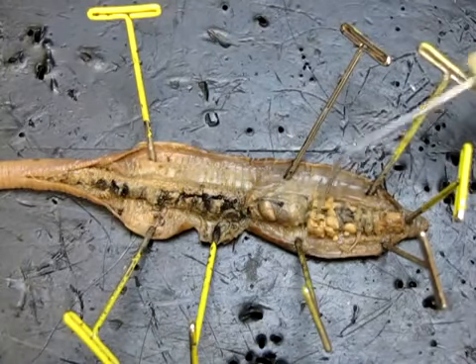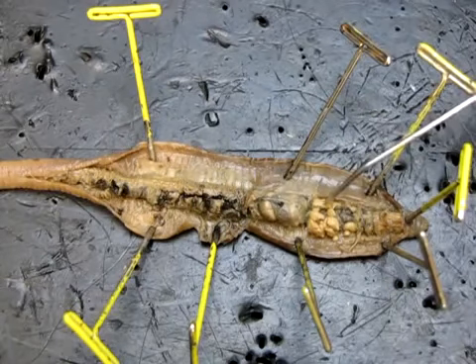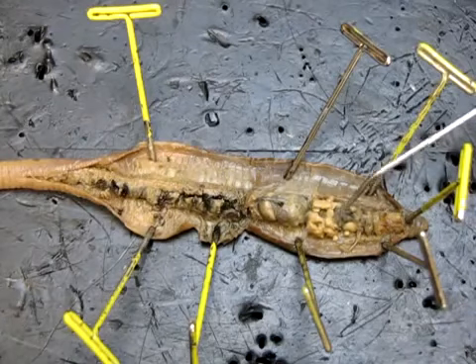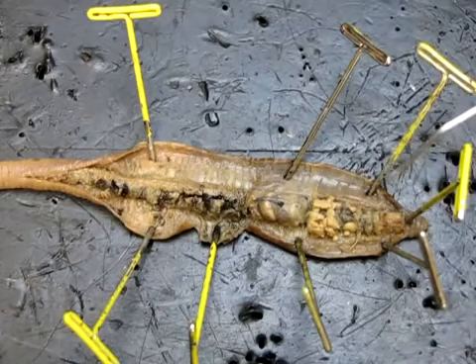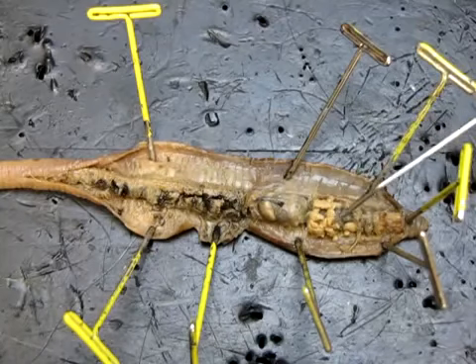So the first thing you'll probably notice are these sort of large fleshy lobes. There's a big one, all this here, and it sort of wraps around on both sides. Those are reproductive organs. They are male reproductive organs called seminal vesicles, okay? And that's basically where sperm are produced.